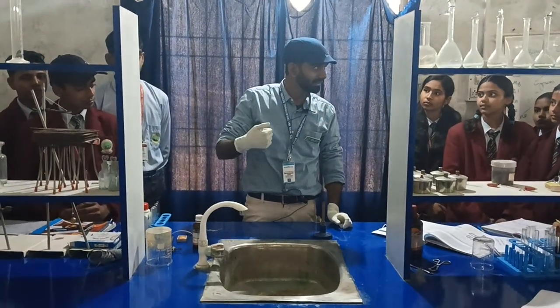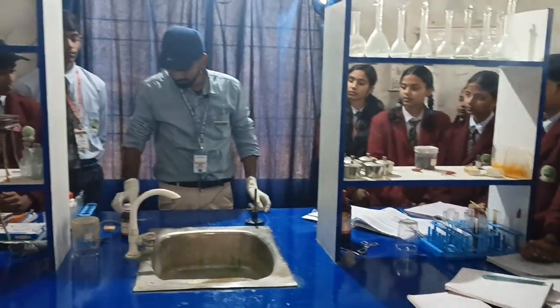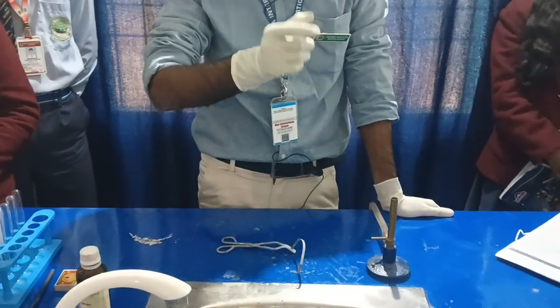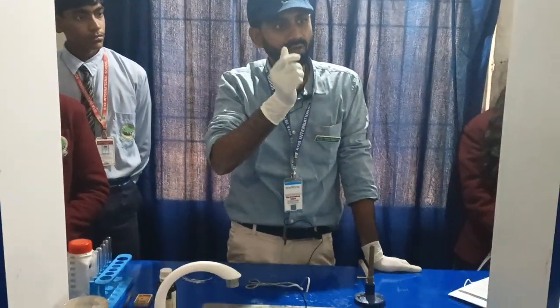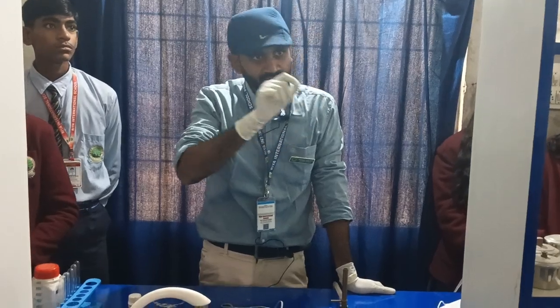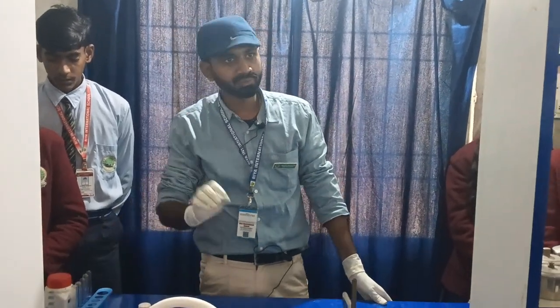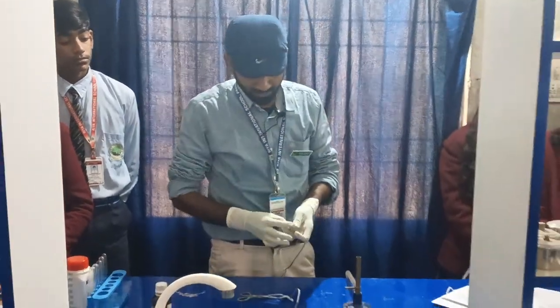We will do many experiments to see how these reactions happen. The first experiment is to burn a magnesium ribbon. We'll see how it burns, and after that we'll see what is the nature of the ash when it dissolves in water — whether it is acidic or basic — and we'll test it with either phenolphthalein or litmus paper.